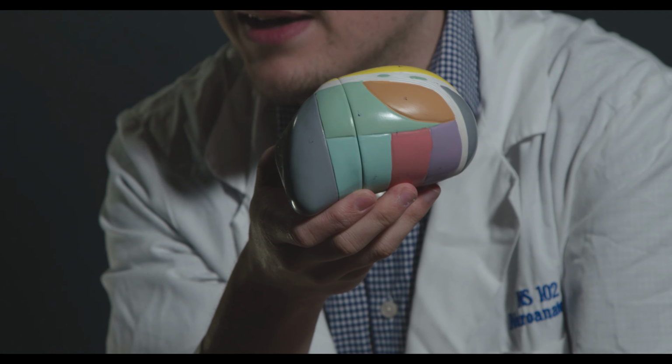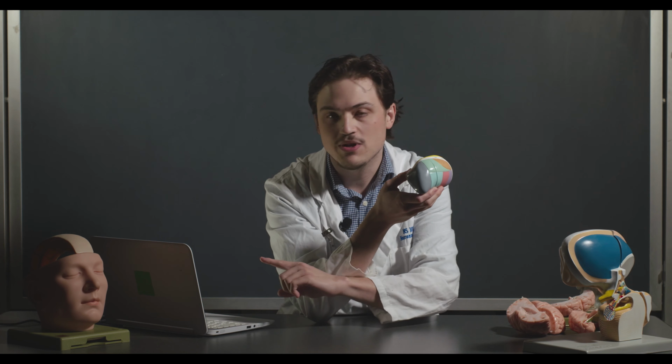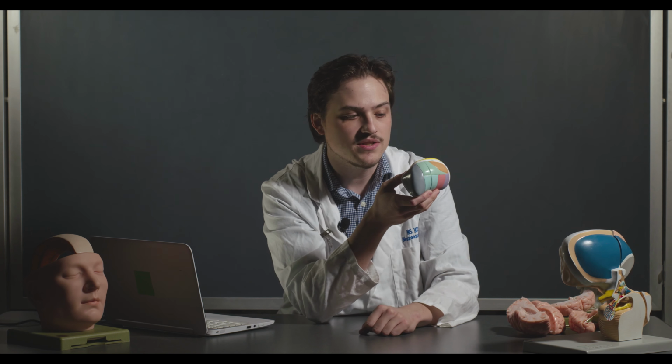So these are all the ones that you need to identify on the lab practicum or the lab quiz, and you're straight up going to get just the image that's in your lab manual. So just be able to identify them there, and you should be solid.